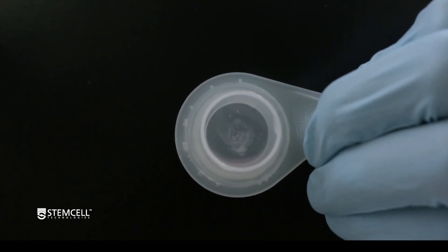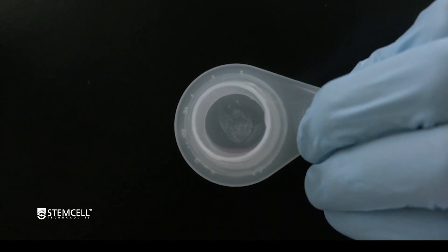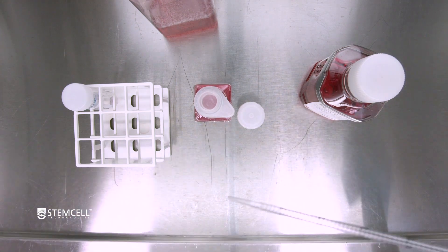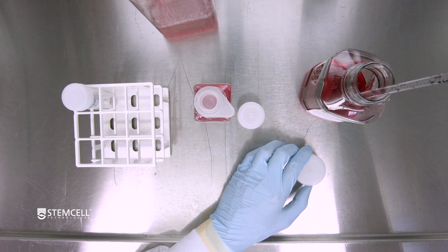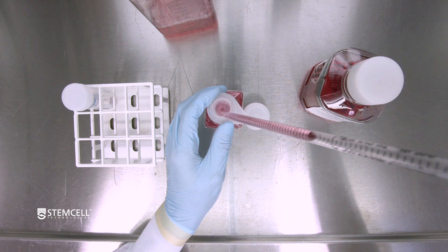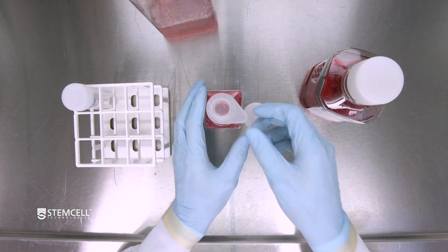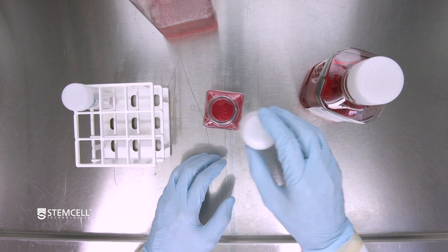Once the aggregates are passed through the filter, inspect the filter to see if any cells remain. If there are some aggregates remaining, aspirate a small amount of fresh media and wash off the aggregates — usually about 5 mls does the trick. The final clump suspension has been created and is now ready for cell counting. Remove the filter from the falcon tube and dispose of it.